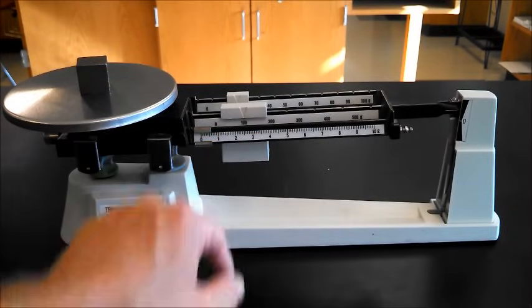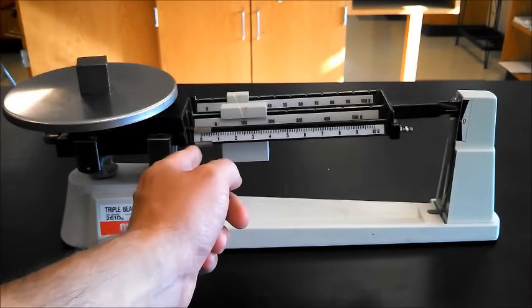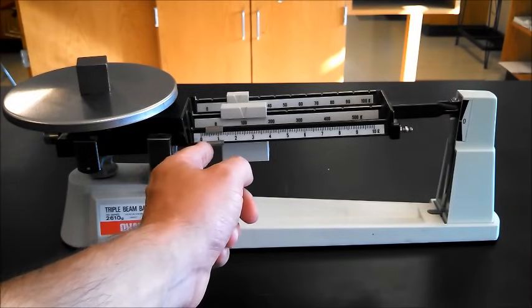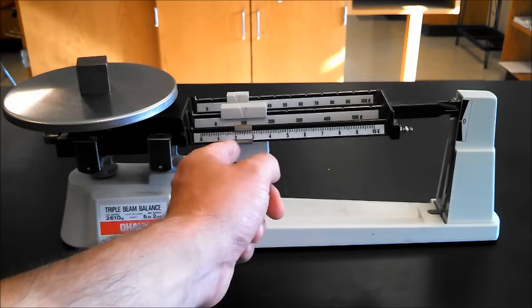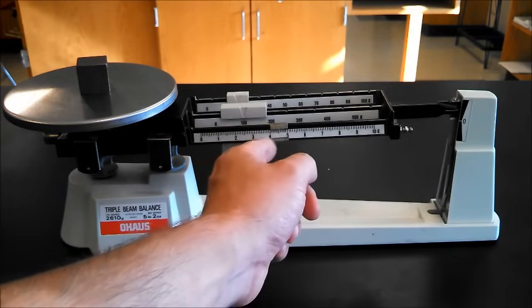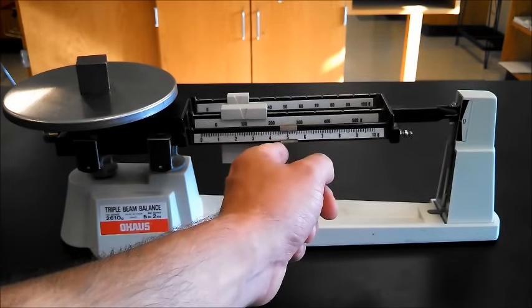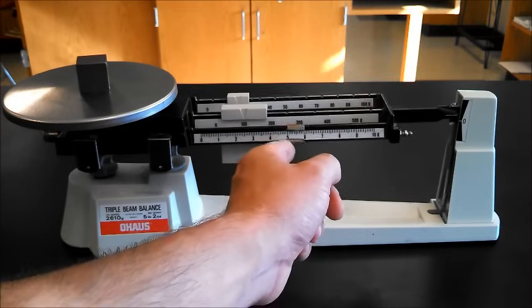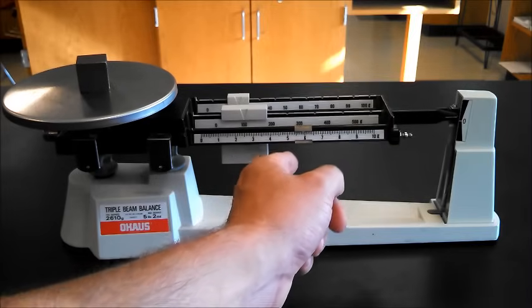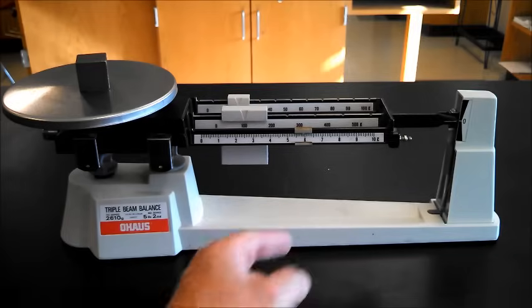Finally, we're going to go to the lightest one, the smallest little mass here. We're going to move that across. Just tap it with your finger, there we go.